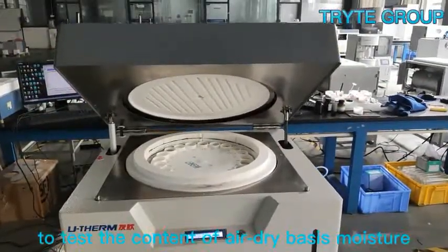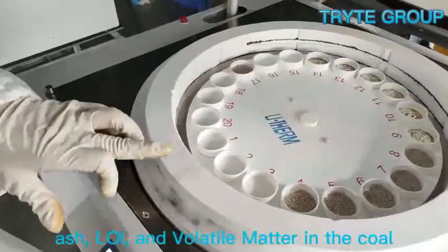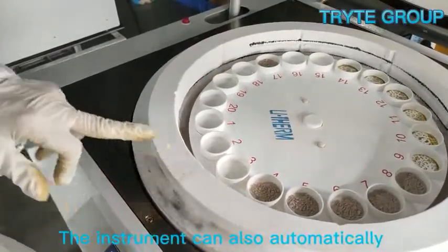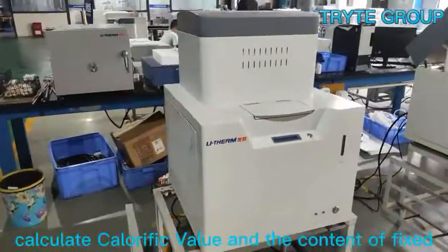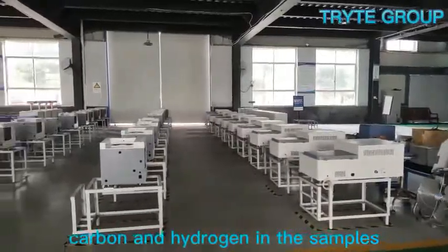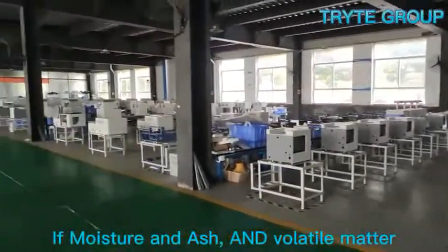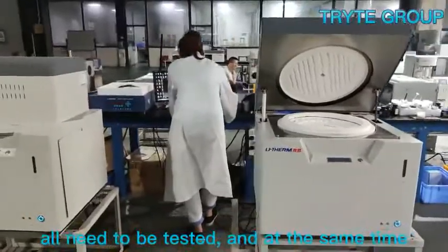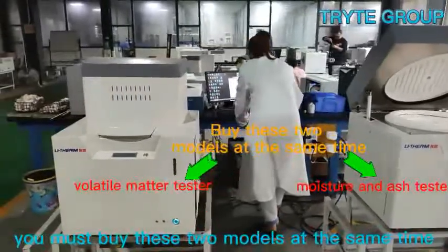The instruments are used to test the content of air dry basis moisture, ash, LOI, and volatile matter in coal. They can also automatically calculate calorific value and the content of fixed carbon and hydrogen in samples. If moisture, ash, and volatile matter all need to be tested and must meet international standards, you must buy these two models at the same time.